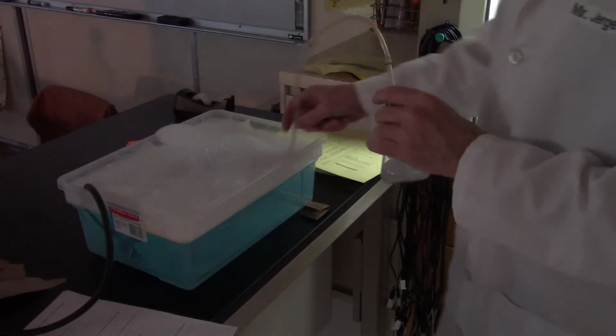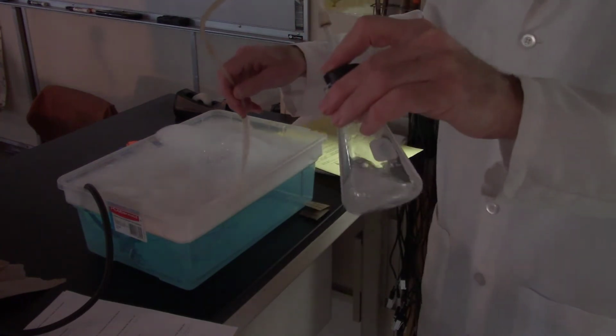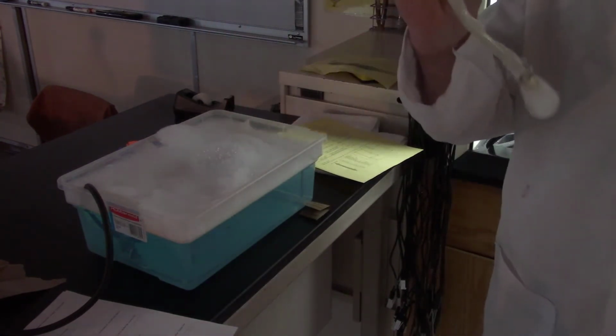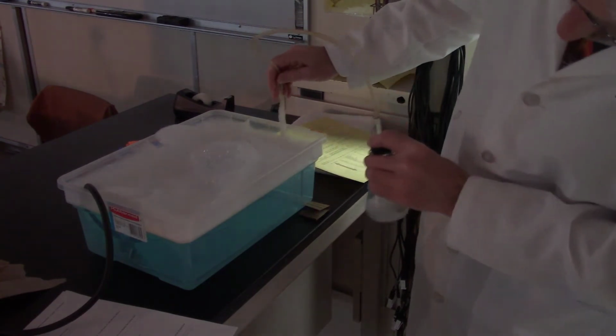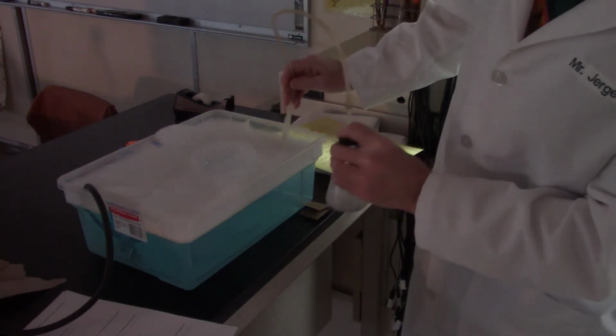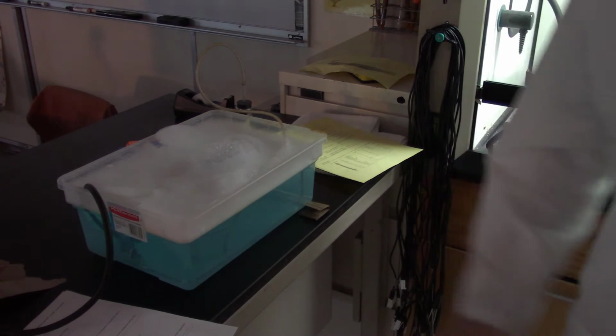So if you look over here into this little tub, we've got our zinc and our hydrochloric acid inside of here reacting. We got some sort of gas coming out of there. I think we figured out what kind of gas it is. And we're making bubbles. Perhaps you can see the bubbles coming out there. Got a bunch of bubbles. And what I'm going to do is I'm going to see some of the properties of those bubbles.